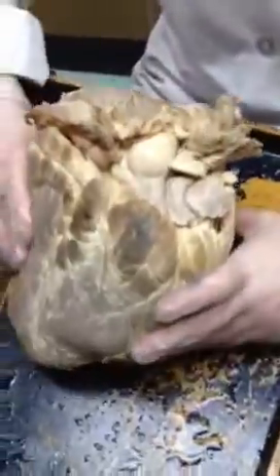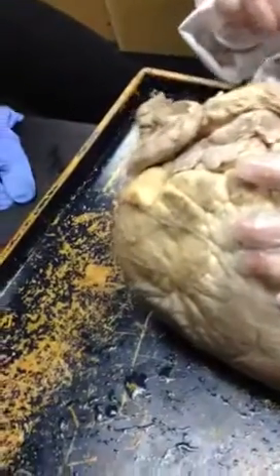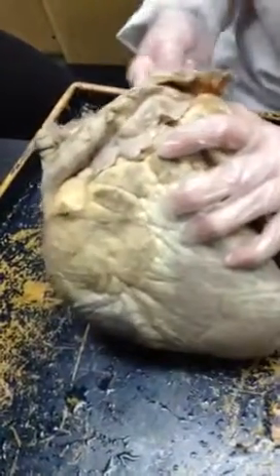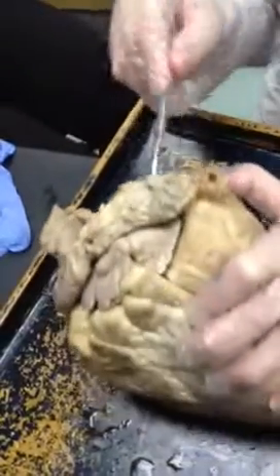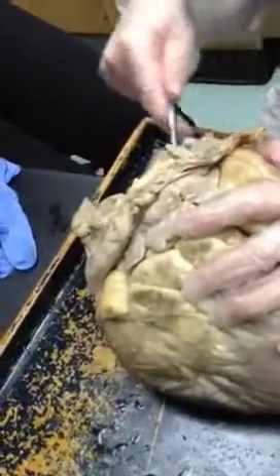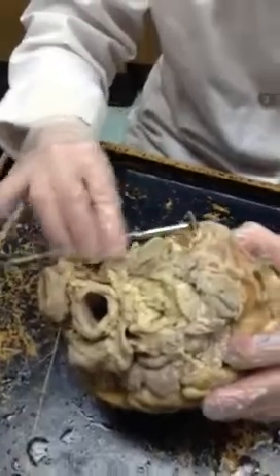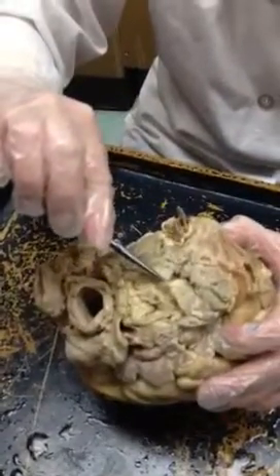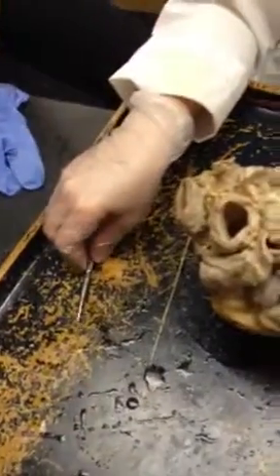The only other hole you would have to recognize is the pulmonary veins, and those aren't really that clear. This was the left side, so we're looking for holes that lead us into the left atrium. There's one hole right here — there should be a total of four, but there won't ever be all four visible. That's the pulmonary vein, and it goes back to the left atrium.